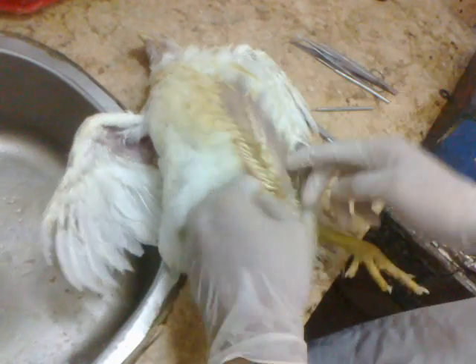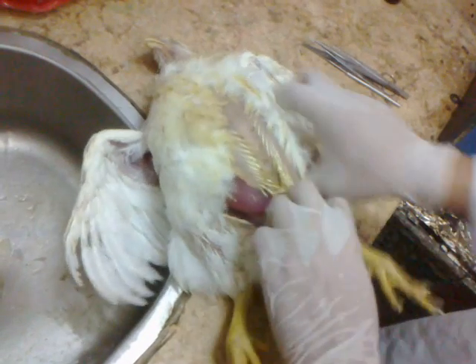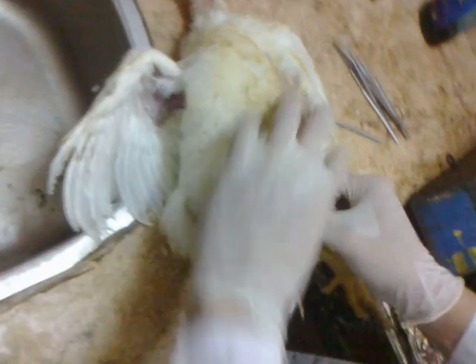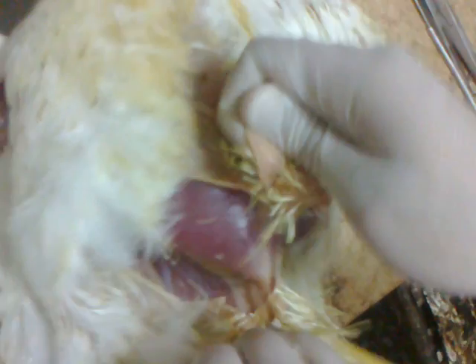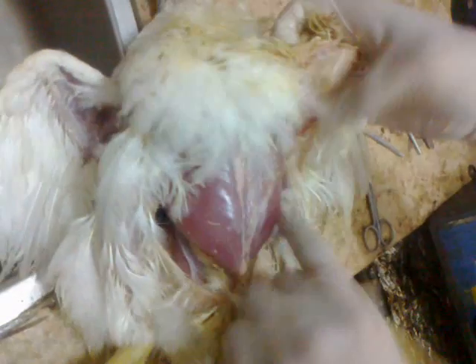By your hand, do blunt dissection like this. Then you connect between both of them. The next step is the reflection of the skin — you catch the skin very well and you reflect it.